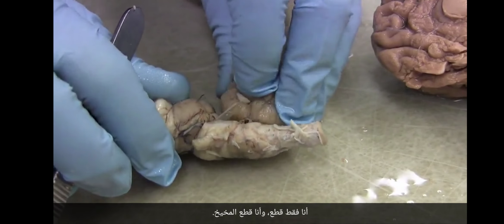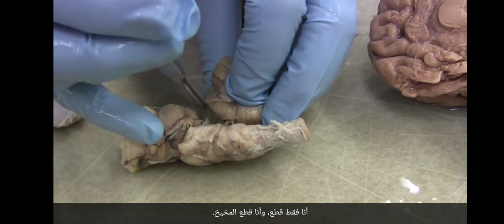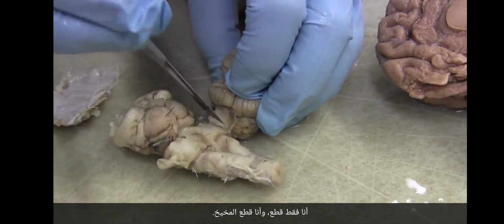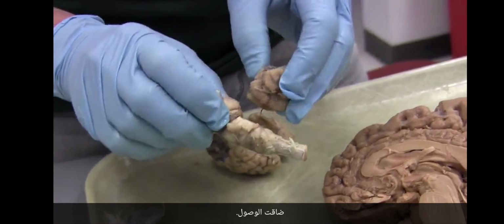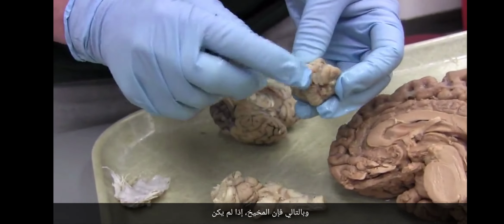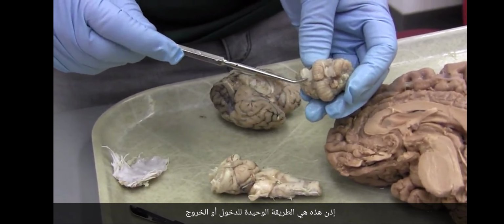I am cutting off the cerebellum. There is no other structure in the brain that has so constricted an access. So the cerebellum, if it were not for these peduncles, would not be part of the brain. It would float off. So that's the only way in or out.